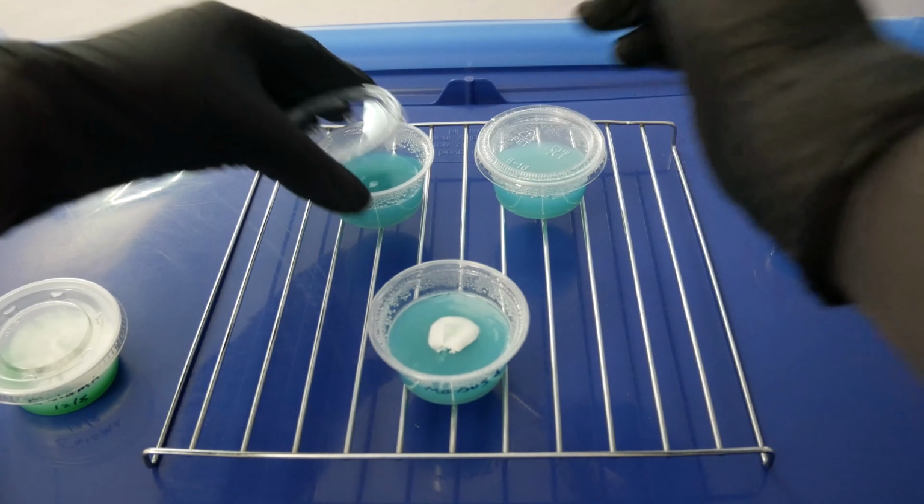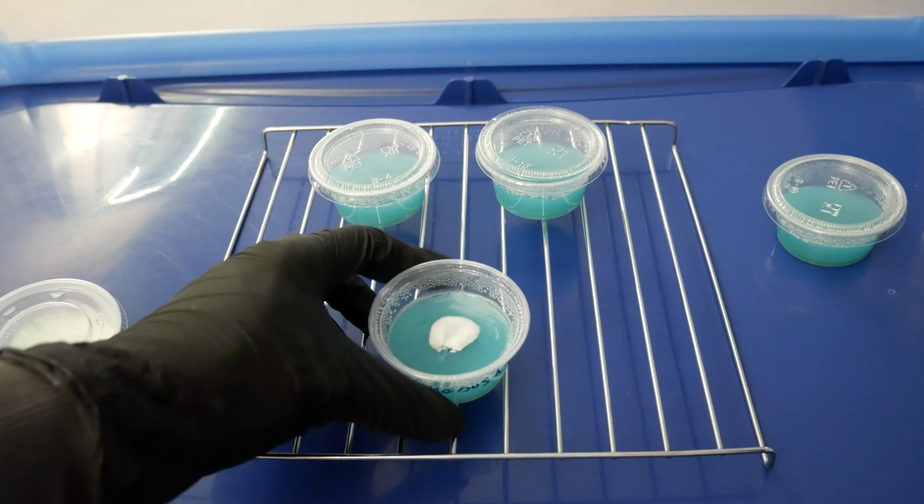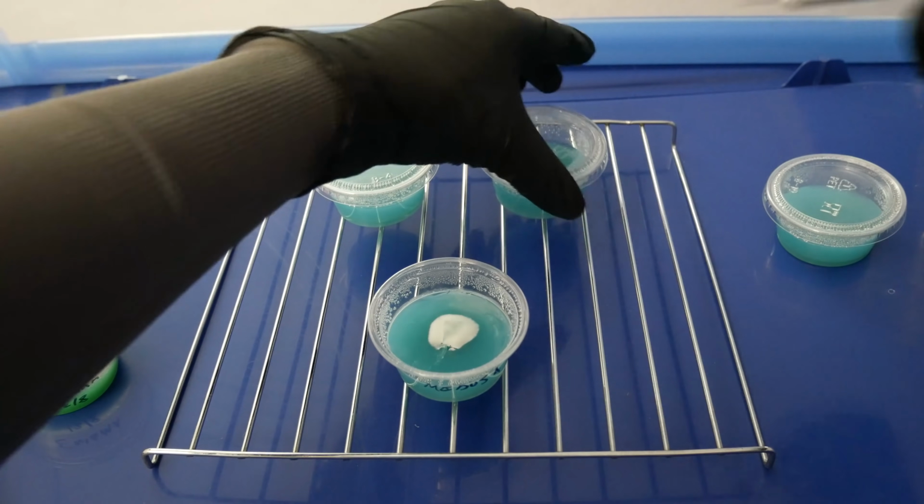You also want to minimize the amount of time that the dish is exposed to the open air. Obviously there's contamination in the air that can get into it, so when I make transfers, I try to drop it in the cup and close it as quickly as possible. It's all part of sterile technique.